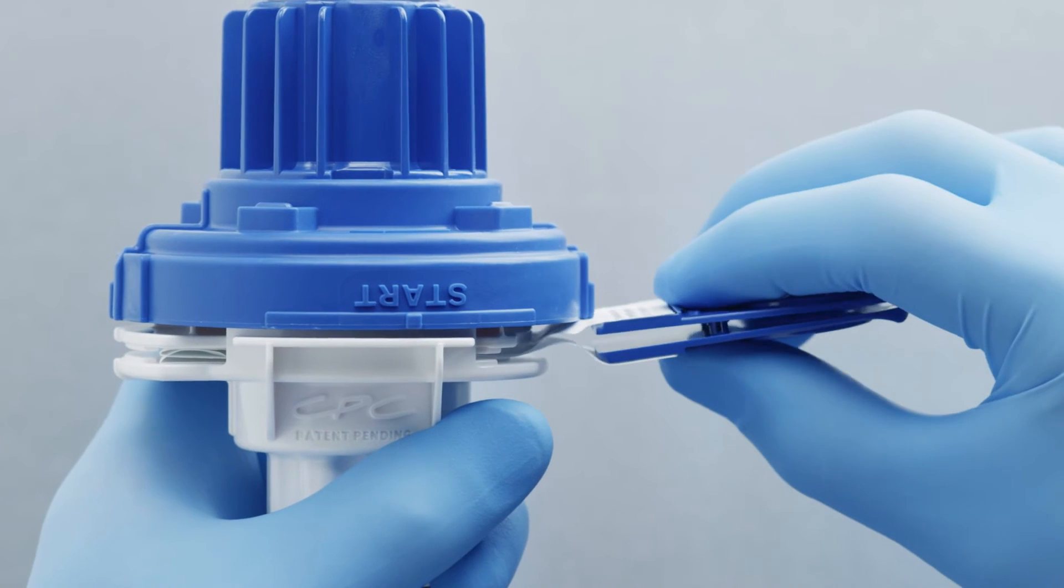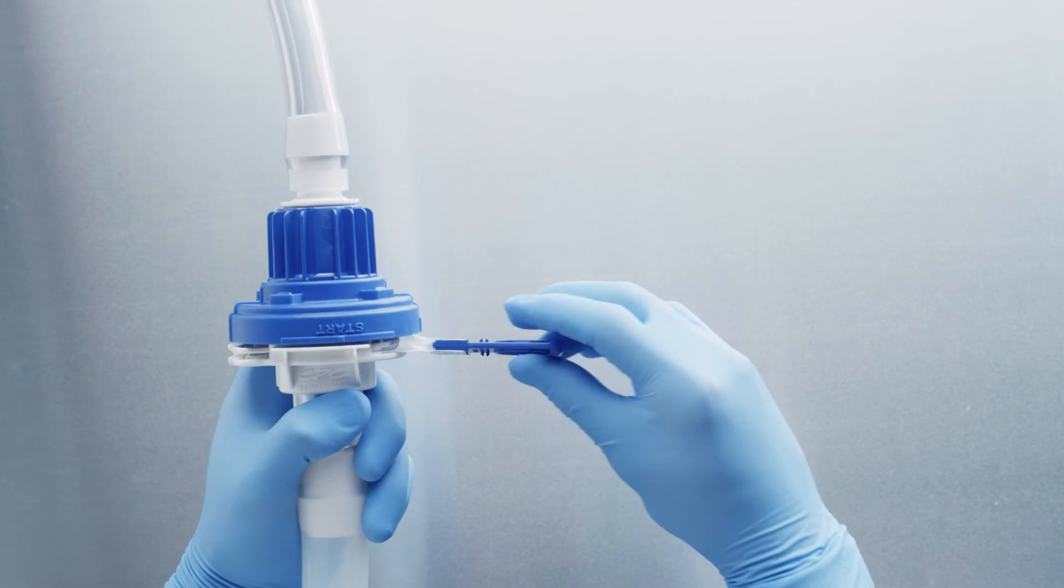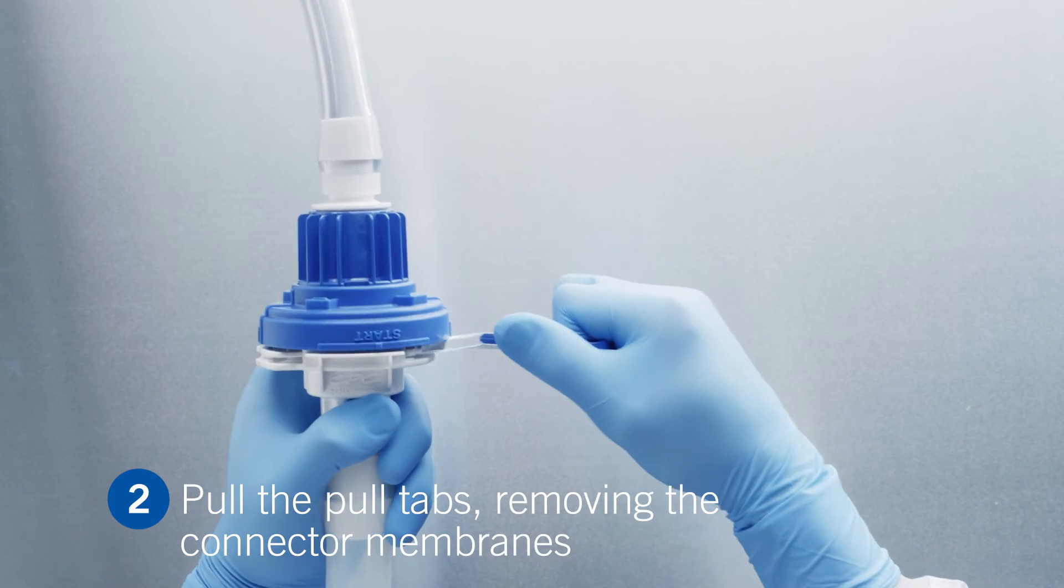Snap the membrane pull tabs together. Pull the tabs, removing the connector membranes.